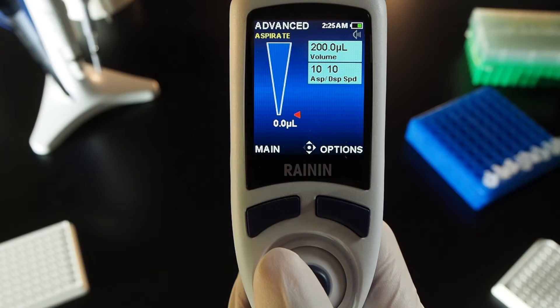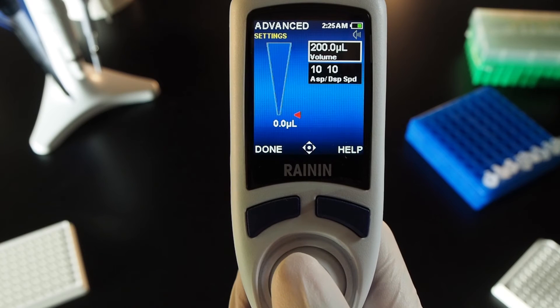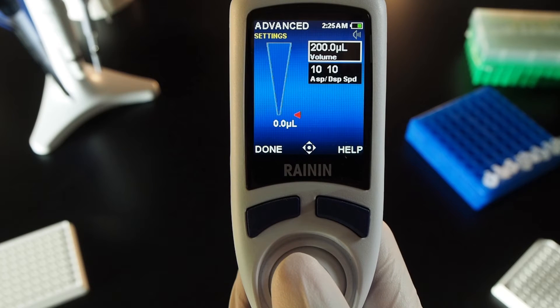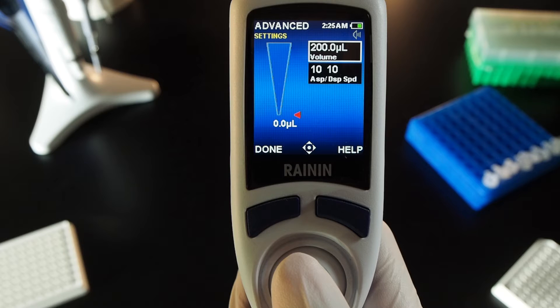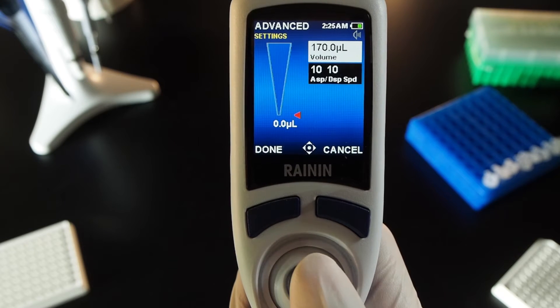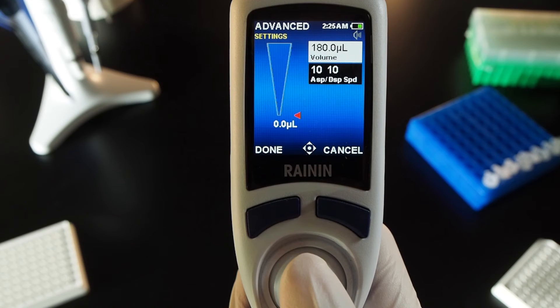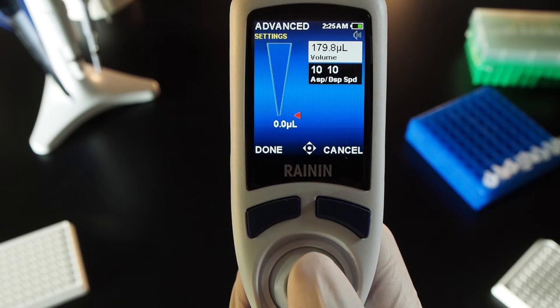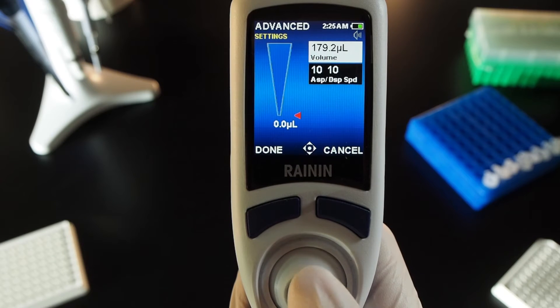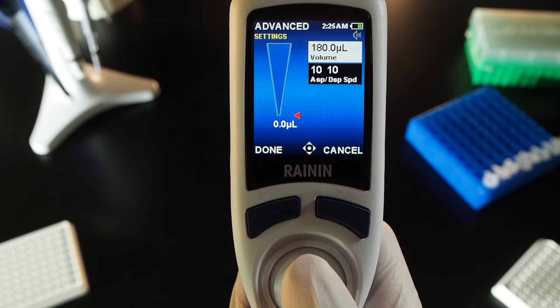Adjust volume aspirate and dispense speeds. Move the joystick right to go into settings. The volume box is lit. Press the joystick in. On this volume pipette, left and right decrease and increase volume by 10 microliters. Up and down change it by 2 tenths. Press the joystick in to set it.